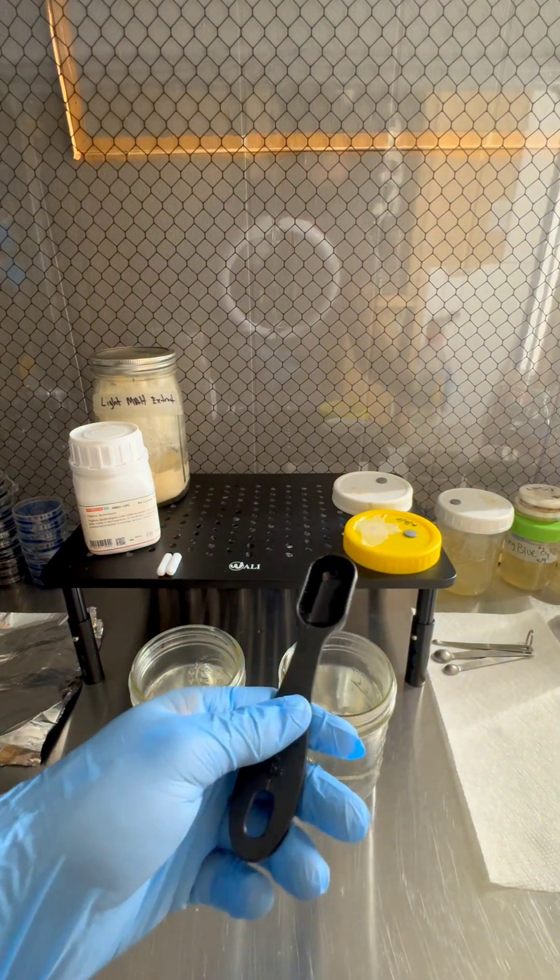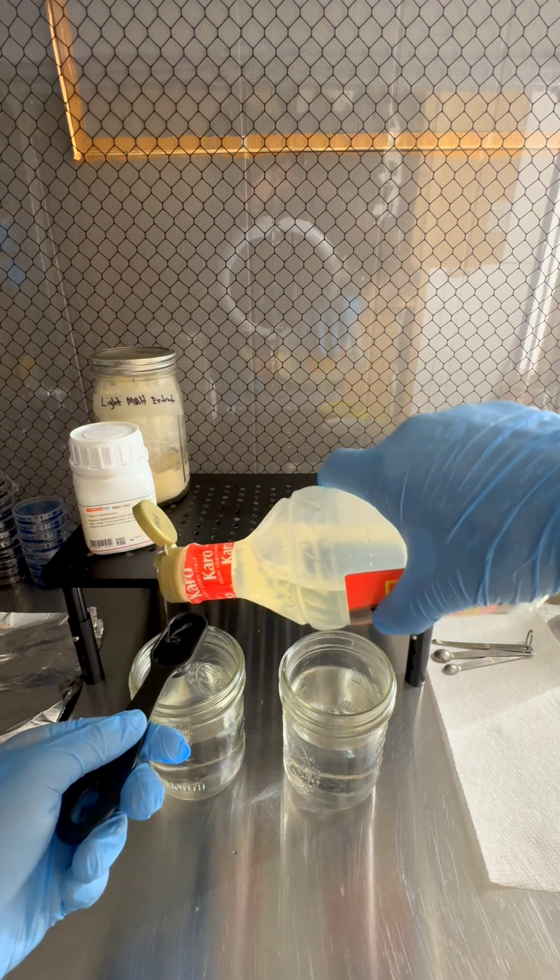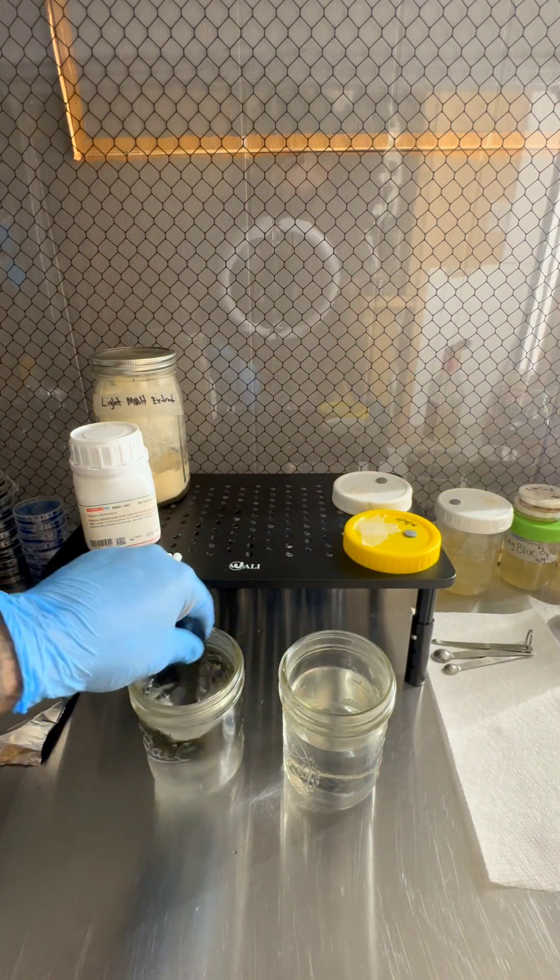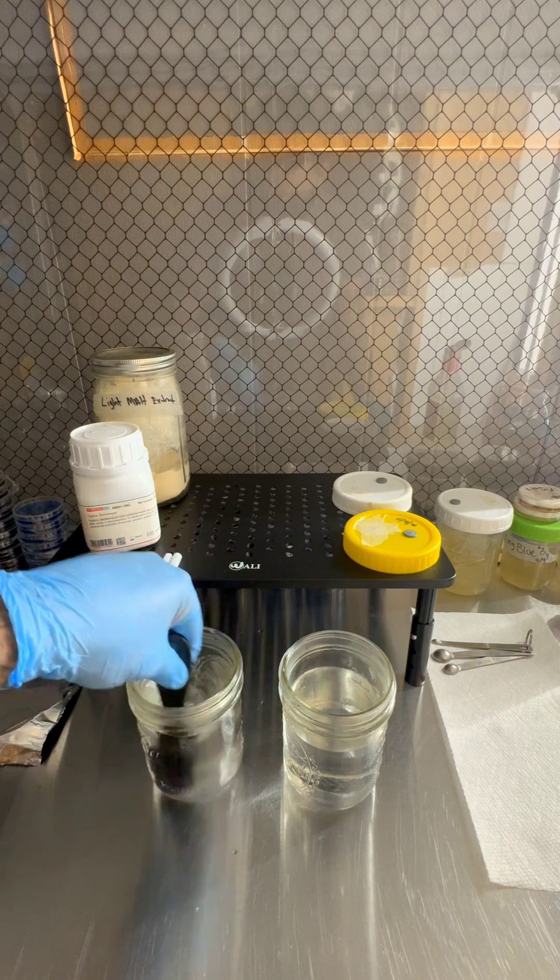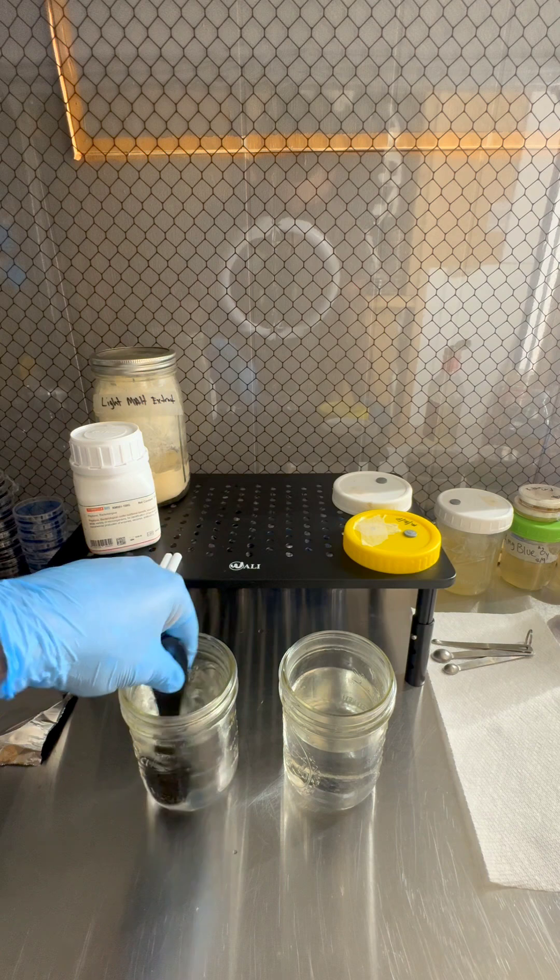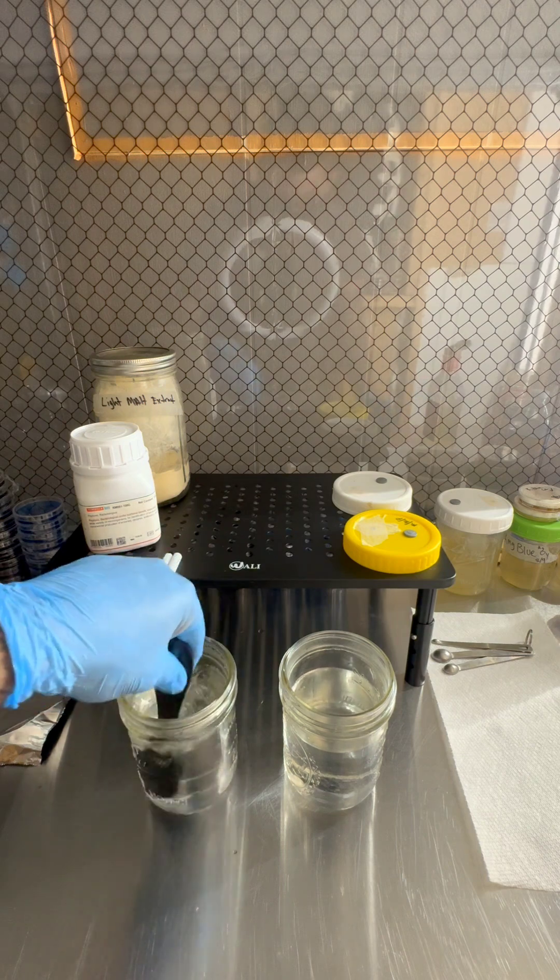And I'm going to go ahead and do the same with the other one. A tablespoon to the 300 milliliters of water. And that's all you need really. A lot of people just use Karo's corn syrup.